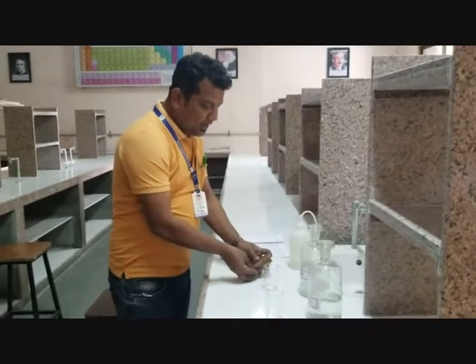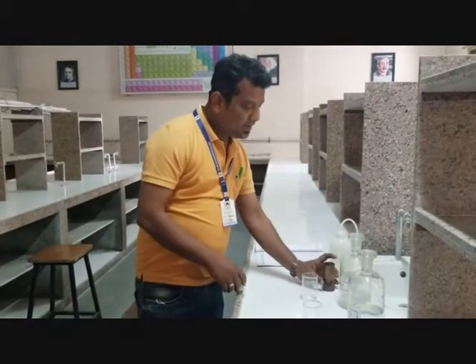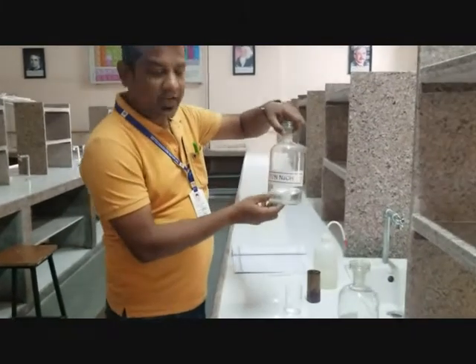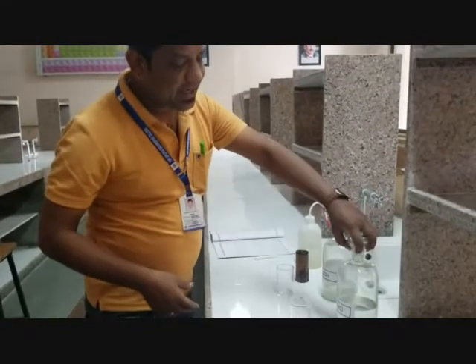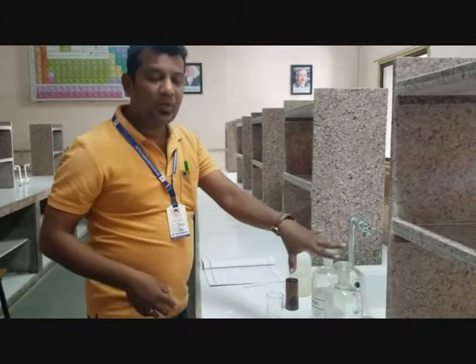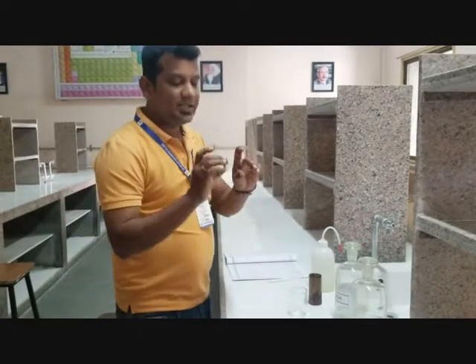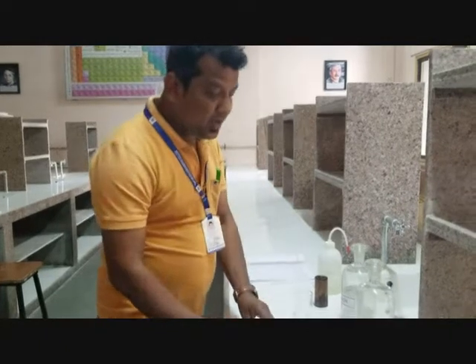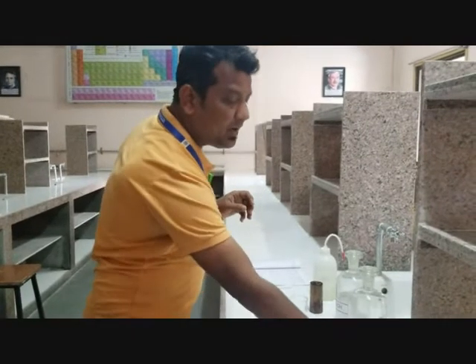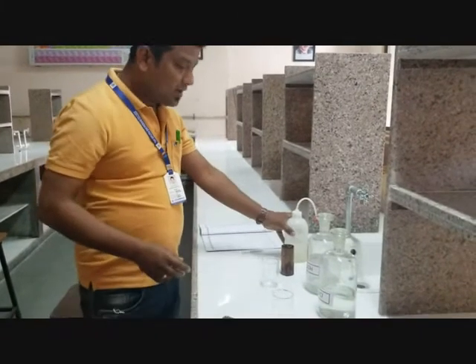Our metal today is a copper strip. Our first medium for corrosion is NaOH solution, which is a basic medium, and the second is an acid solution, which is an acidic medium. In both mediums we will perform the corrosion practical on this copper foil. To measure the pH we have pH paper, and to remove the corrosion layer we have emery paper, distilled water, and tissue paper.